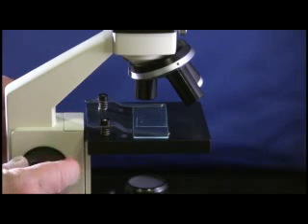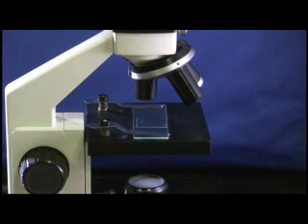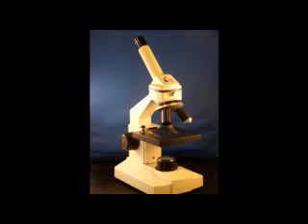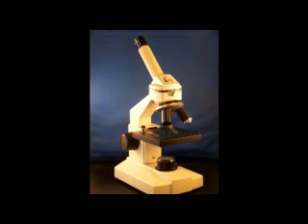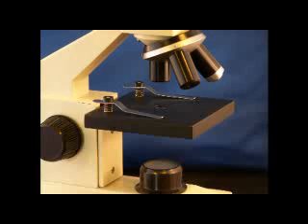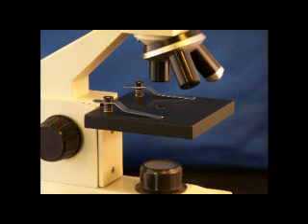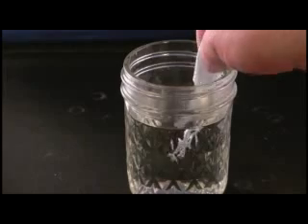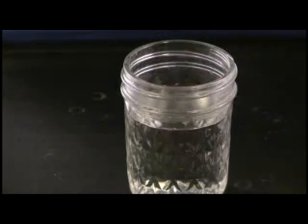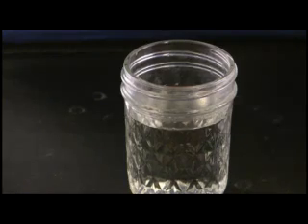Once you have a sharp image with a low power lens, you should be able to simply click in the next power lens and do minor adjustments with the focus knob. Look for any microscopic organisms such as algae or amoebas. Draw any organisms you see under the microscope in your science notebook. Now, use a pipette, eyedropper, or straw to pick up some pond water from the bottom of the sample, and repeat the same procedure with the microscope.